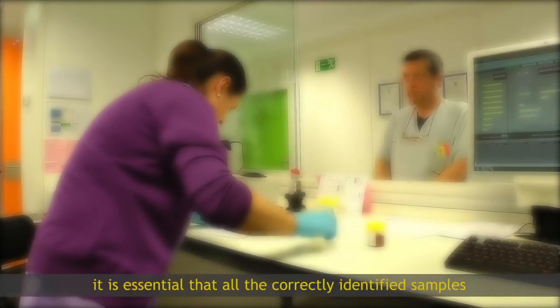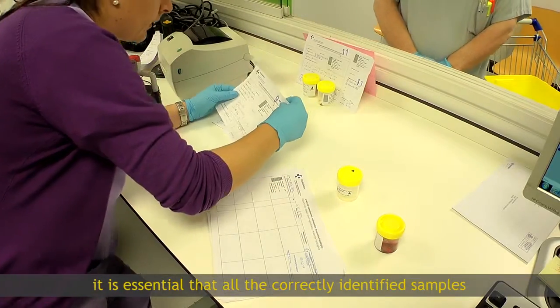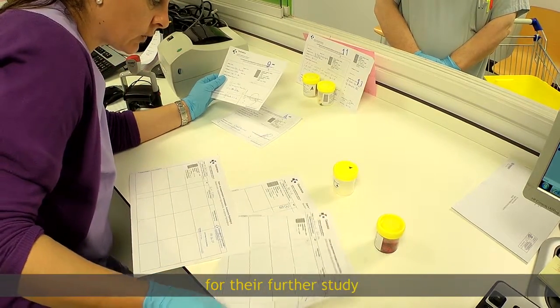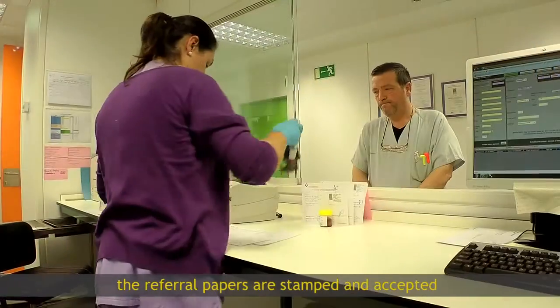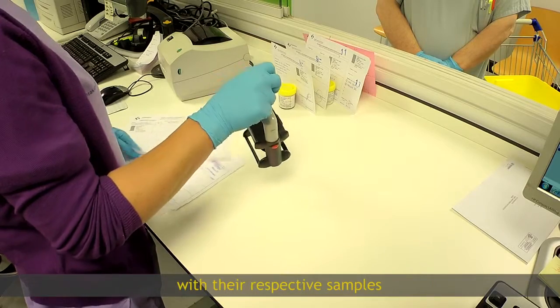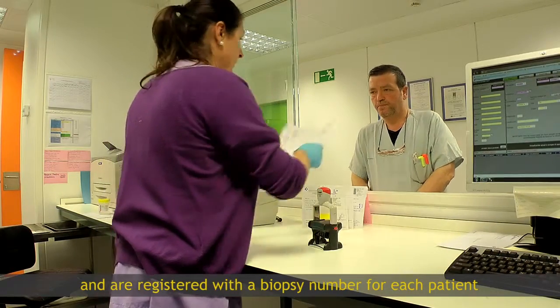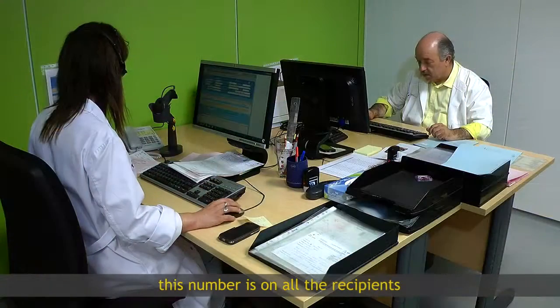It is essential that all the correctly identified samples from the referral are accounted for for their further study. If there is no discordance, the referral papers are stamped and accepted with their respective samples and are registered with a biopsy number for each patient. This number is on all the recipients.